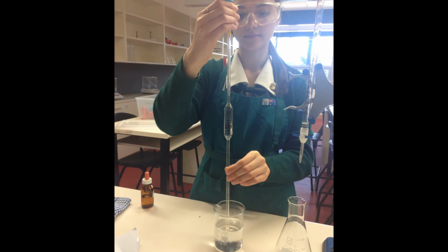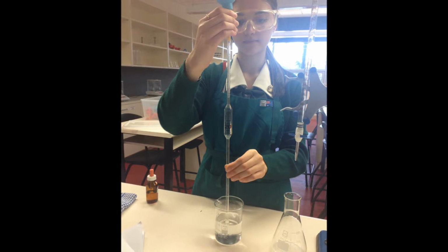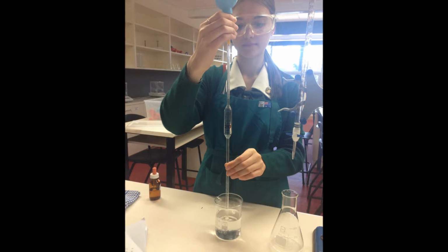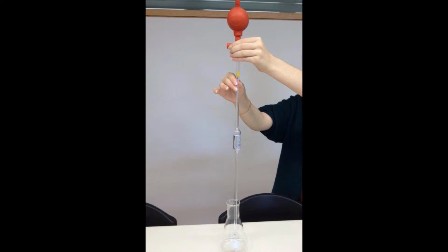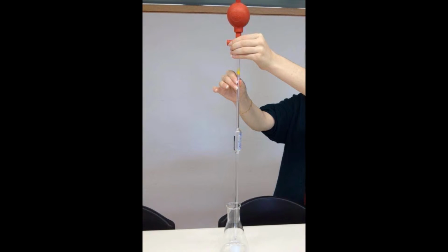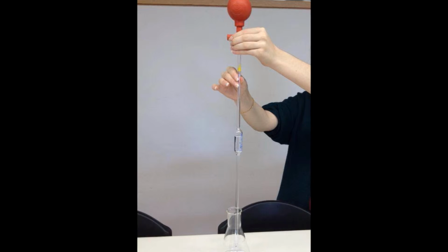Step 3. Once the burette is set up, rinse the pipette with deionized water before rinsing with the solution it will contain. In this case, the pipette will contain the analyte, being the hydrochloric acid. After rinsing, use the pipette to measure 25 ml of the unknown volume of the analyte. Place the solution into a clean flask. If there are any splash droplets stuck on the wall of the flask, use deionized water to rinse it off. This will ensure every molecule of the analyte is in the main solution.